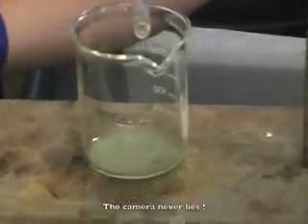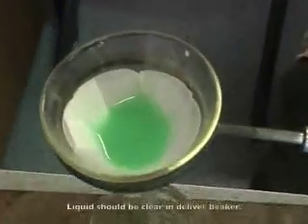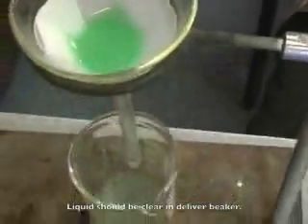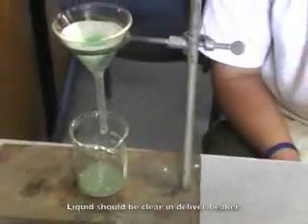We have a bit of colour coming through in the water. Some might have got through the side, but I can see the chalk on the filter paper anyway. So there's a residue at the top there. Yes, there is a residue at the top, and the liquid coming through is fairly clean, but there might have been a bit of spillage down the side.